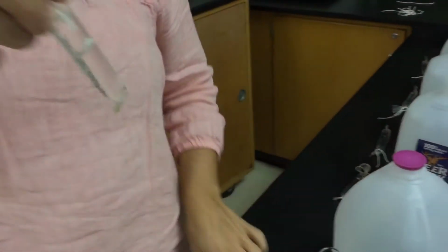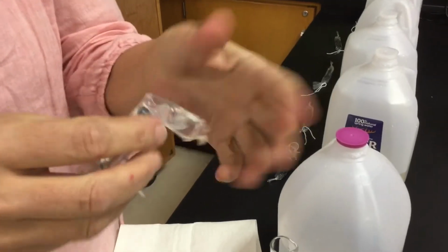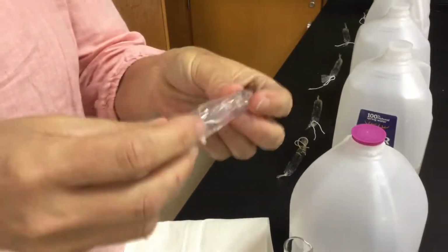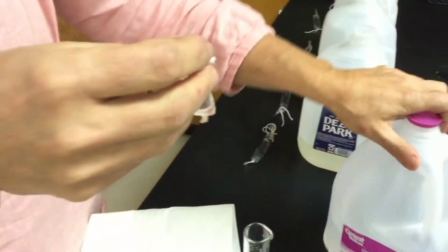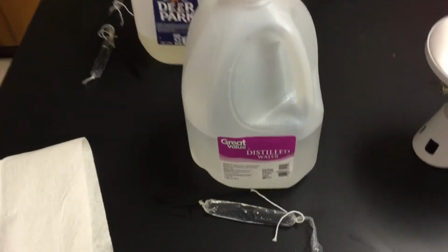So you can blot them kind of dry if you like. If you think you got anything along the sides, it now is contained. So when I said this is kind of selectively permeable, it's not like we're going to squeeze it and things are able to go through the pores. That's how tiny they actually are. So this is my distilled water, and I placed them in front of each of them. We now need to weigh them.